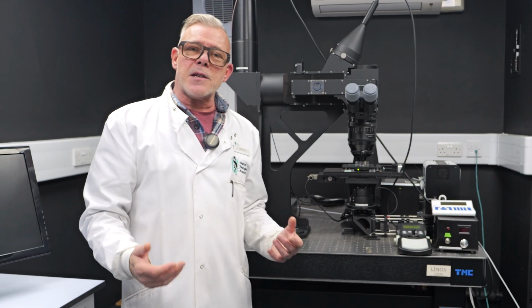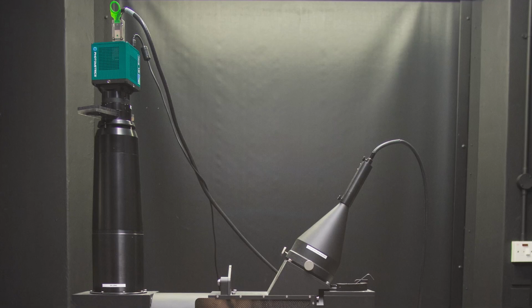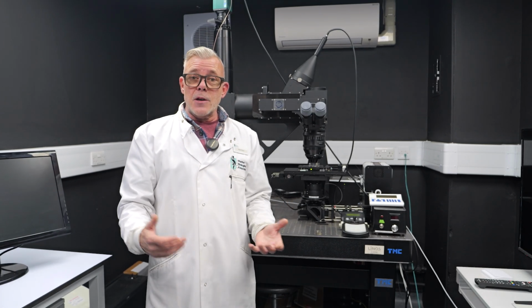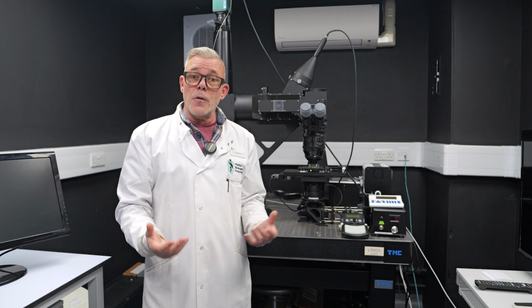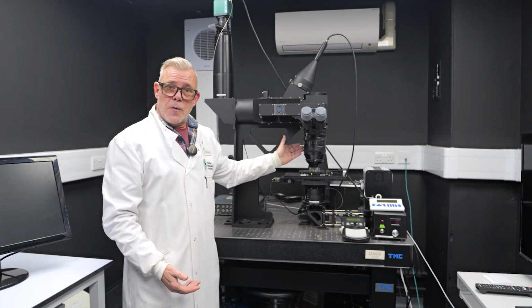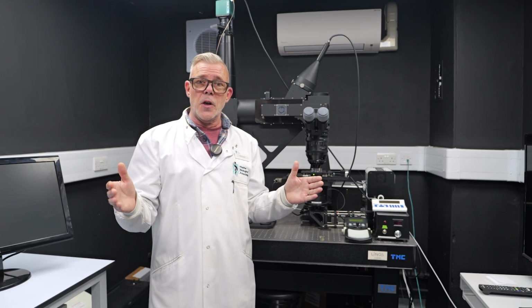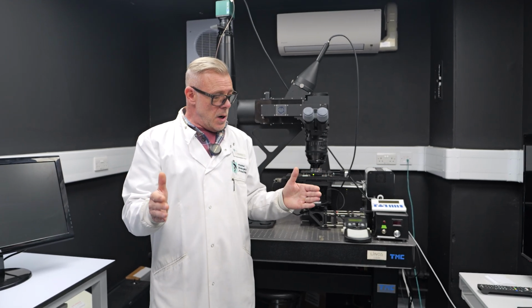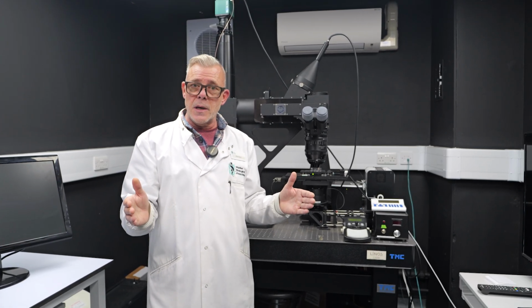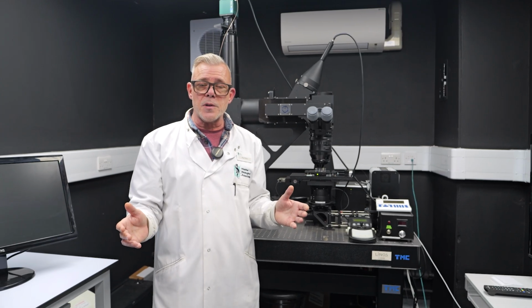The MBA now has a very sophisticated microscope called the Mesolens. There are only a small handful of these currently in existence. The clear difference between traditional benchtop microscopes and the Mesolens microscope is the enormous microscope objective that the Mesolens has. And this enables a very wide field of view. So we're able to view many, many more cells, hundreds to thousands more cells, on the Mesolens microscope than we can view on a traditional benchtop microscope.